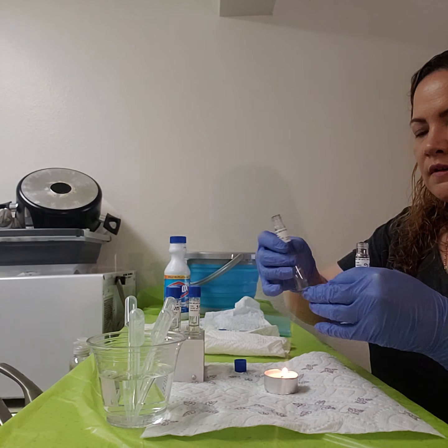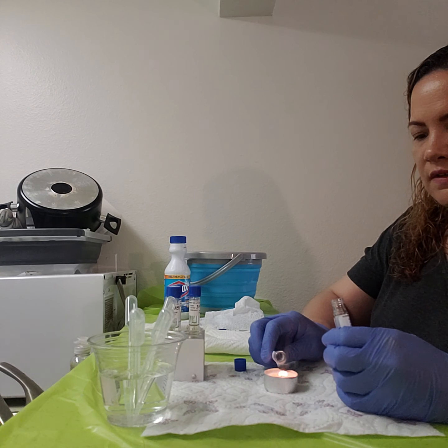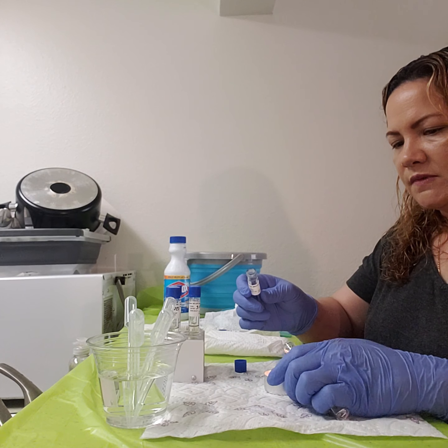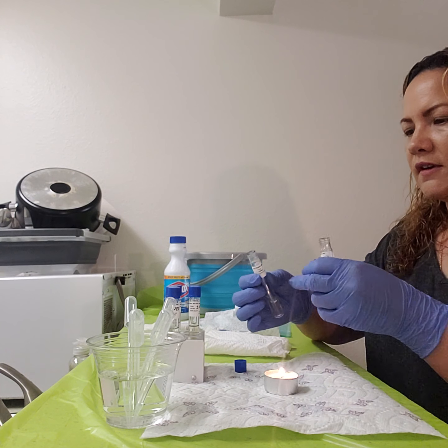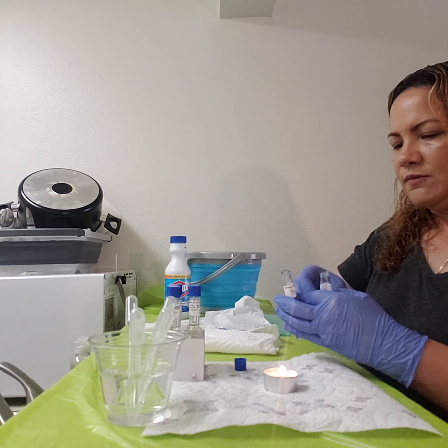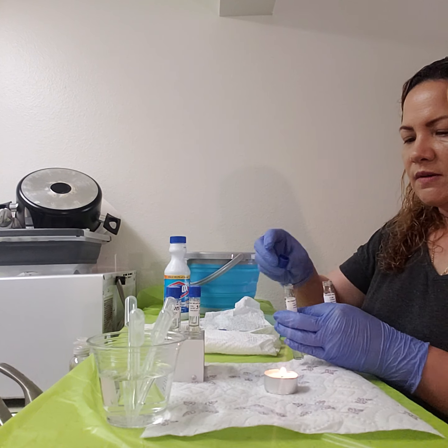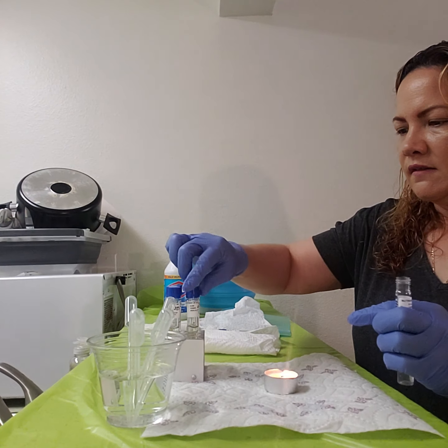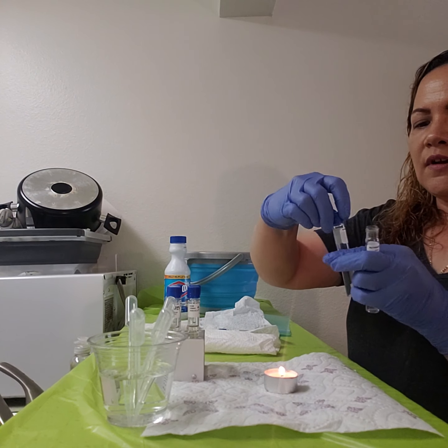Okay, but I'm going to sterilize the tips on the top of both. Oops, I'm going to go a little bit too close. Okay, you kind of know what the idea is here. I can actually leave this one open because I'm going to be using it. But this one I'm going to put back on. Okay. And I'm going to do it again with the 7%.